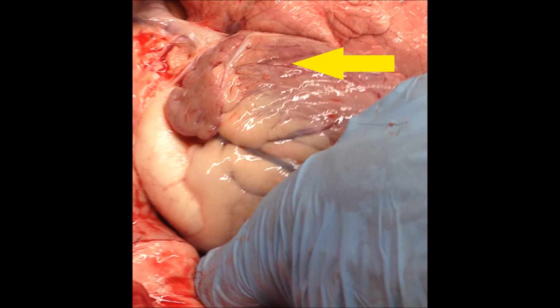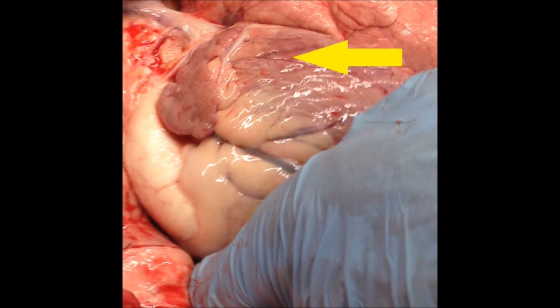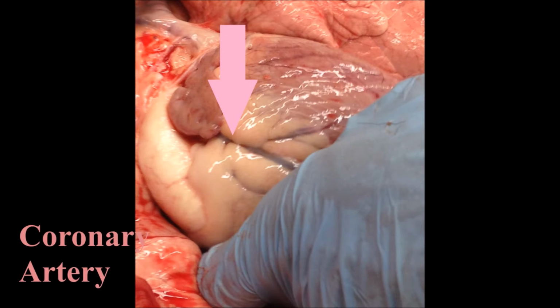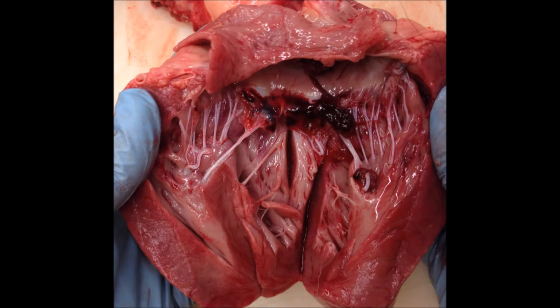The first thing you can see looking at the heart is the thin membrane surrounding it called the pericardium. You can also see the blood vessels on the outside of the heart called the coronary arteries. Once you open up the heart, you can get a better view of the 4 chambers and valves that form it.